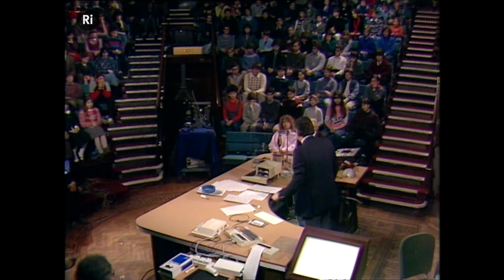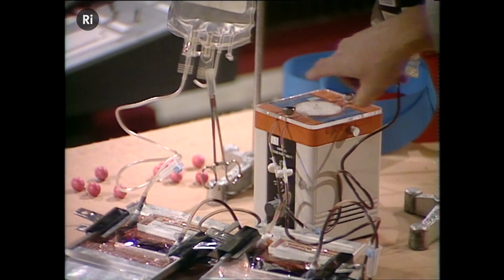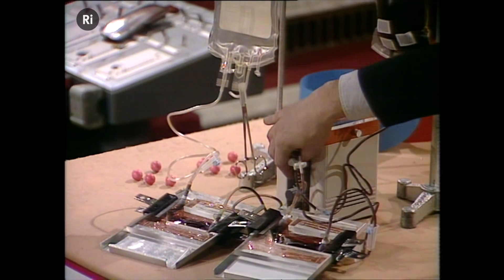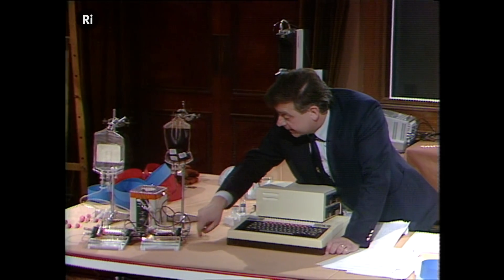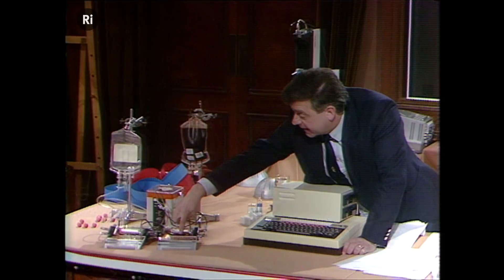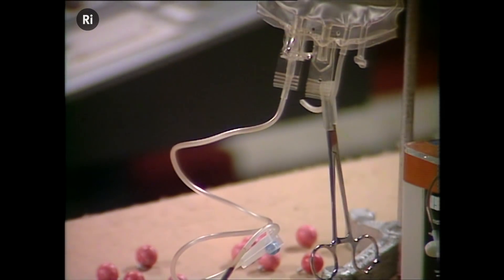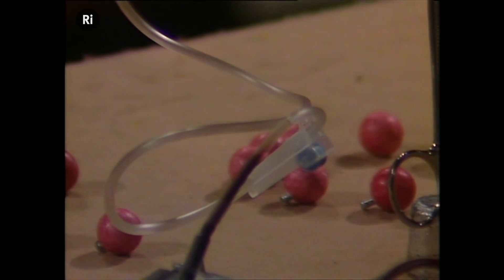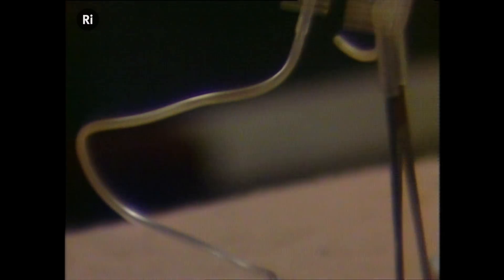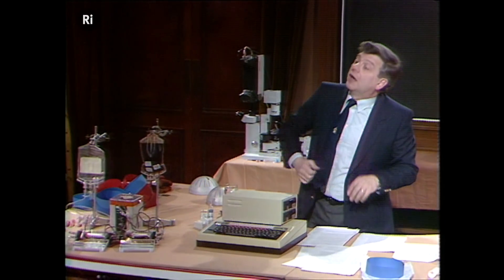Here's the bag with the sample before we've removed the cancer cells. And we're pumping it through here, pumping the blood through — it's coming through down here. And it's going over these magnets here, two lots of magnets to be sure. And as it goes over, it pulls out the cancer cells with the magnetic beads around them. We'll collect into this bag the cleaned-up, purged bone marrow that no longer has the cancer cells, which we can give back to the patient after they've been treated.